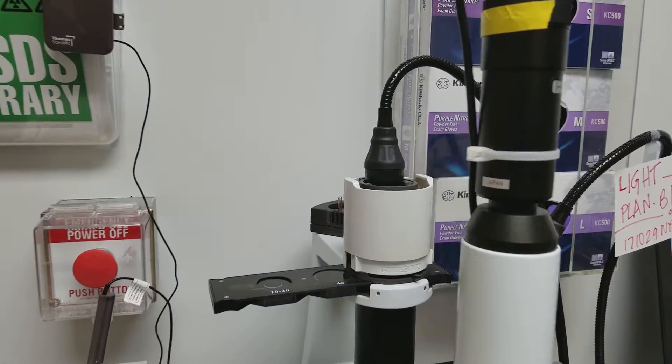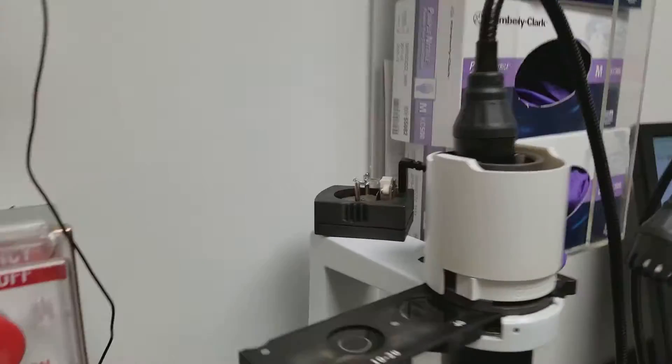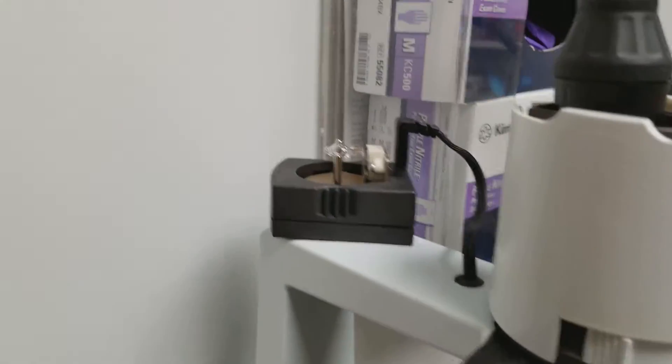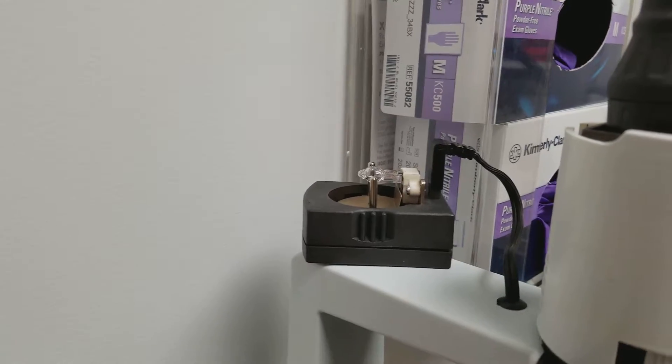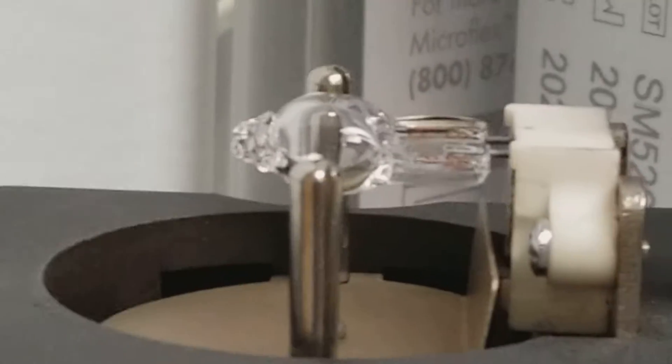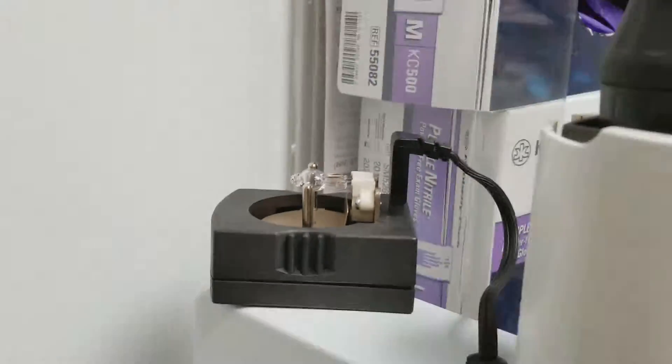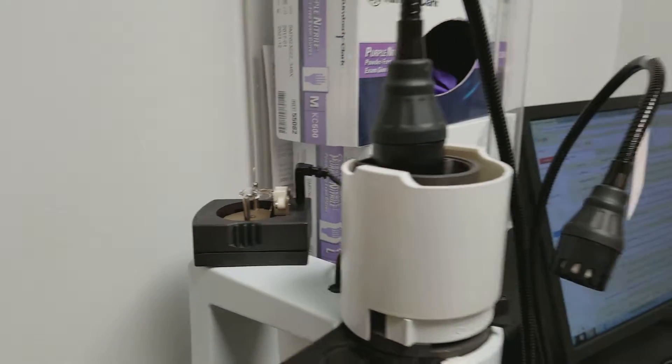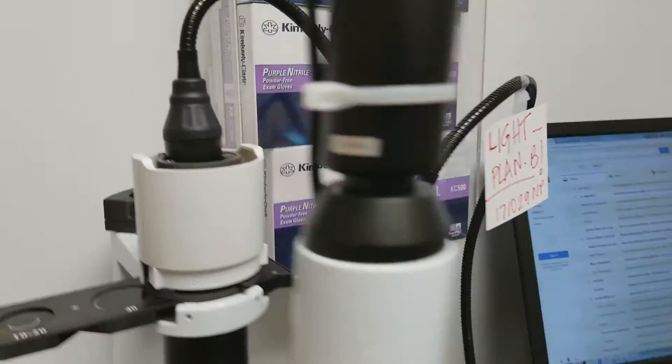What went wrong today is that this lamp is fine. This light bulb is just fine, but it doesn't want to turn on. So this is plan B here.